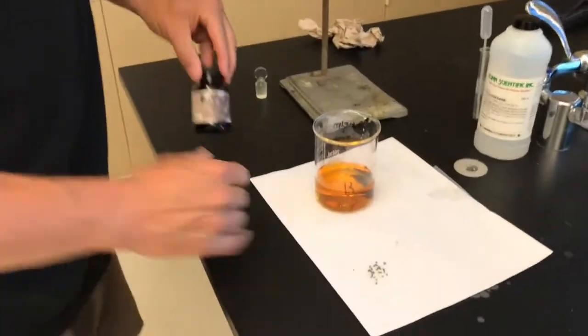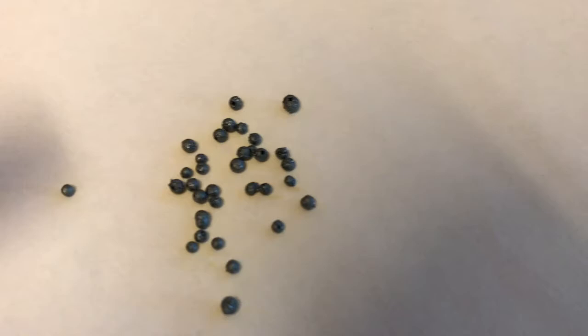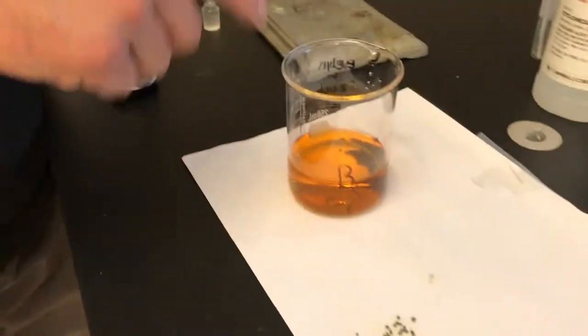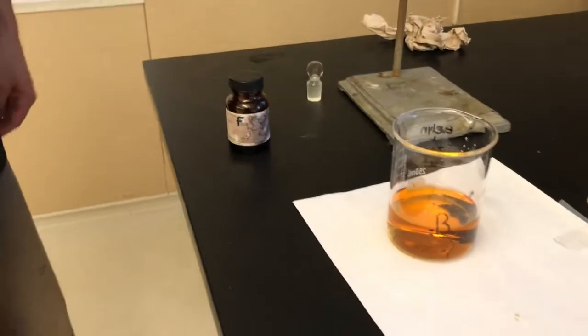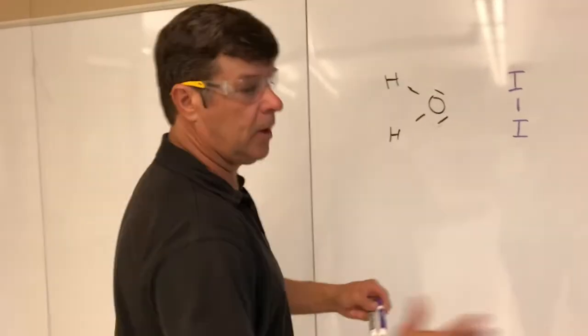Hey, so what I have here is iodine, and you can tell it's solid at room temperature, which is kind of curious. It's I2, and a couple days ago I put some iodine in water, and you can tell that the iodine dissolved in the water. So iodine, thinking it's I2, is nonpolar, doesn't have a dipole, and water, it being polar, you wouldn't think it would dissolve, but certainly does. You can tell by the color.